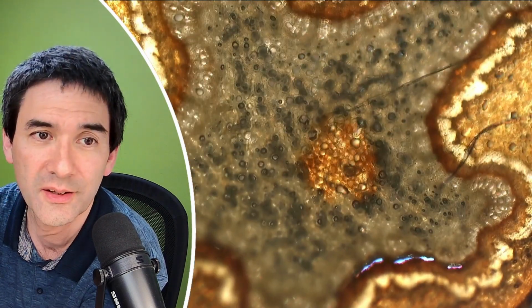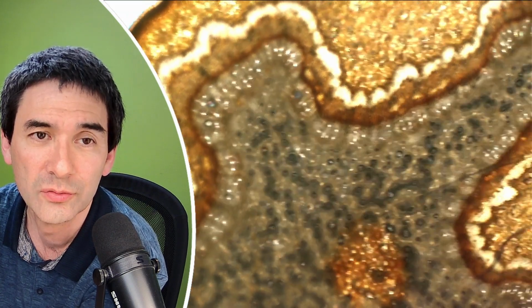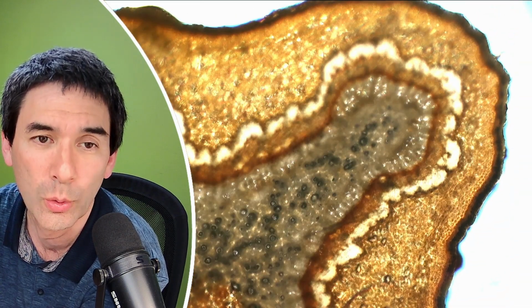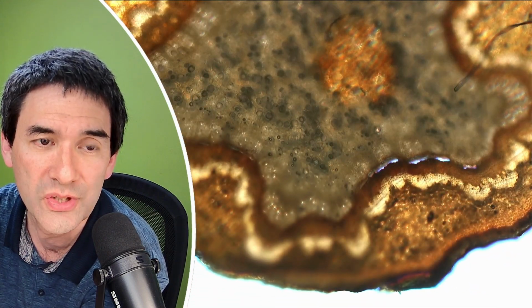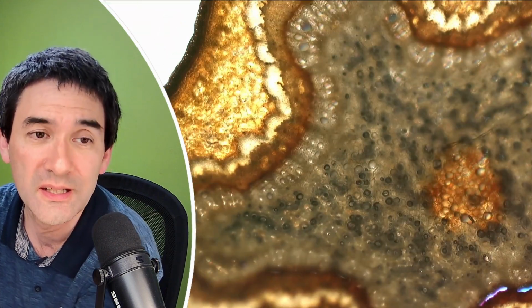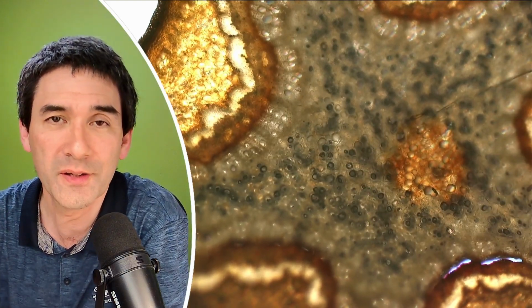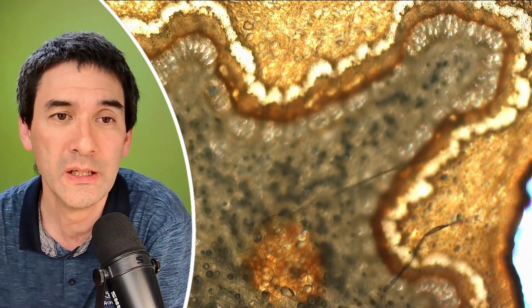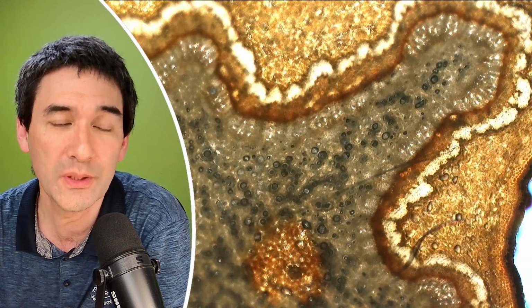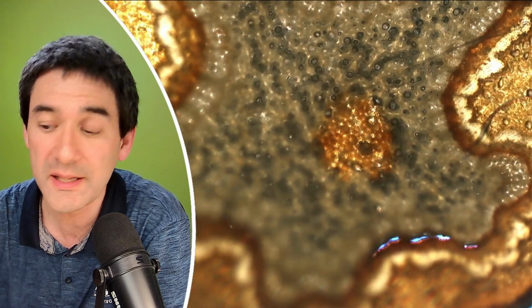Yeah, and this one over here is the one where I used the razor blade with a 3D printed holder, and this is how it looks here. You see, it's very uniform, very consistent. And indeed, this is actually just a simple demonstration of something that I've already known, because I've been testing those knives already before. And indeed, the razor blade one actually worked up to this point the best.